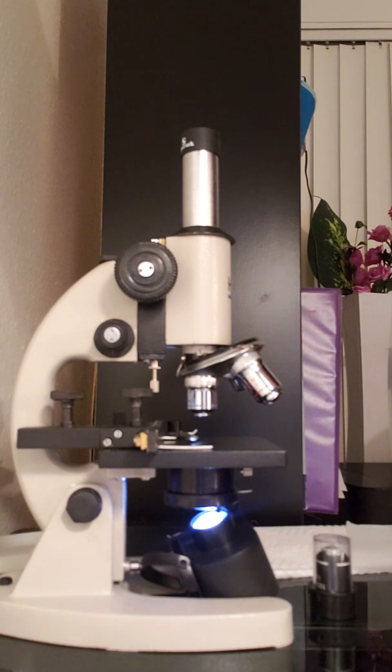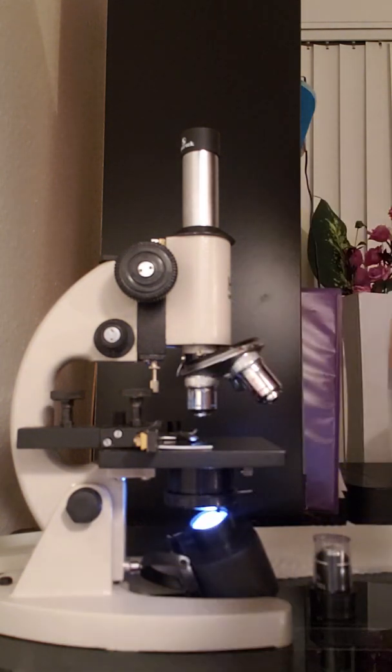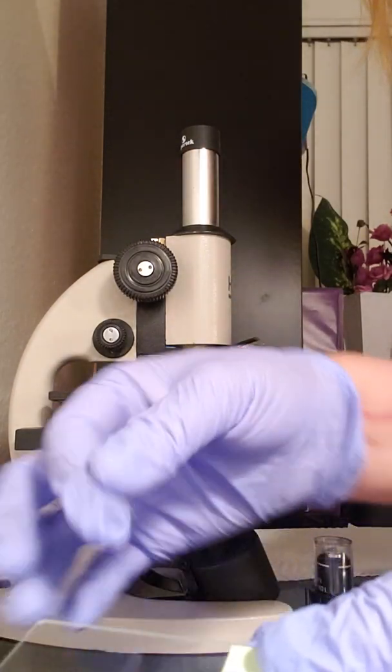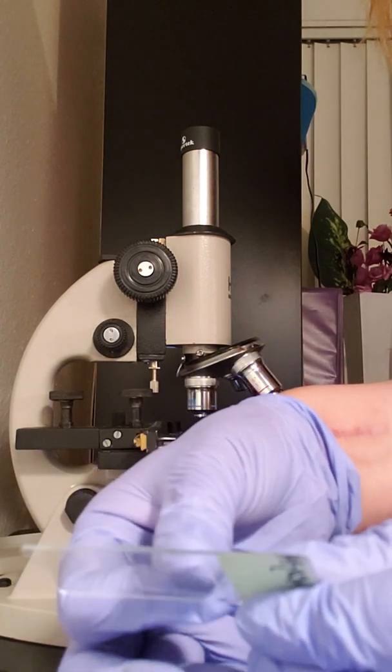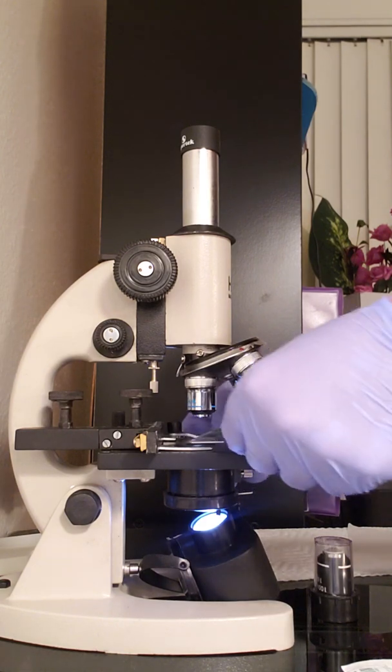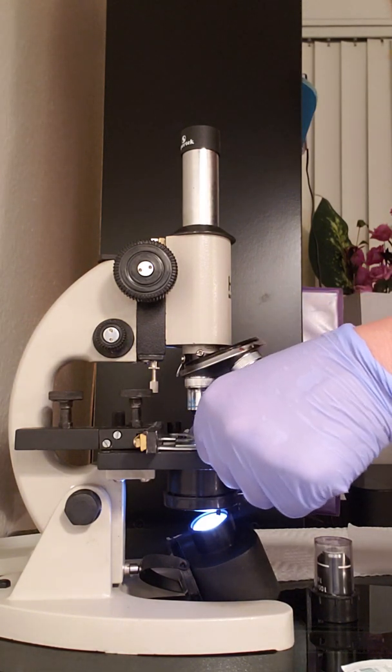Okay. And then I'm going to put a drop of the distilled water. And I'm going to use one of the little tiny square slides to cover. So see, I did put a drop on here. It's hard to show you. And then, oops, it's moving around. And then I'm just going to stick that on. And then I'm going to view that one now. So I'm going to put that under the scope.